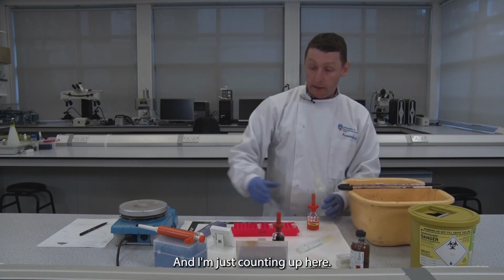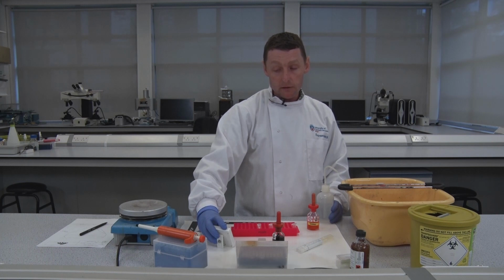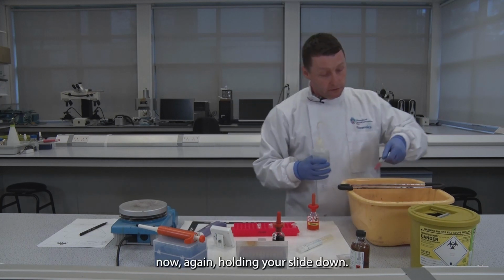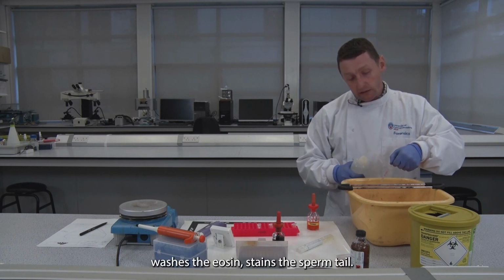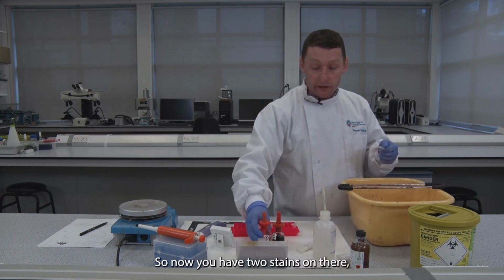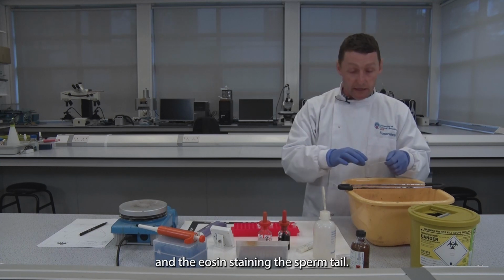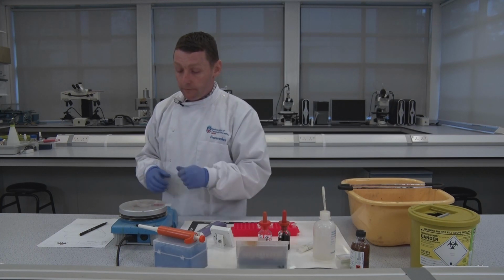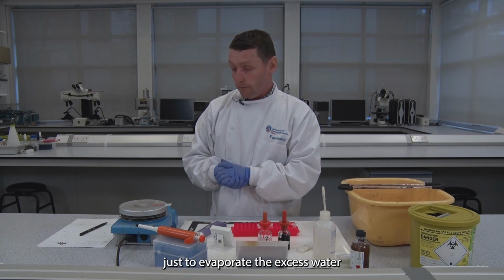And I'm just counting up here, so it's reached 30 seconds. Now, again, holding your slide down, nice gentle washes. The eosin stains the sperm tail. So now you have 2 stains on there: the hematoxylin staining the sperm head and the eosin staining the sperm tail. This now goes for the final time onto our hot plate just to evaporate the excess water.